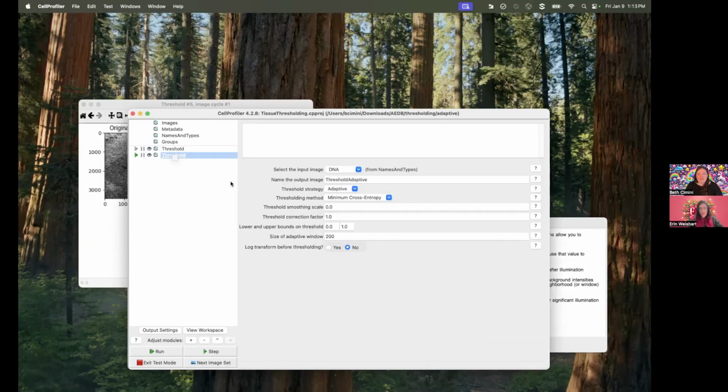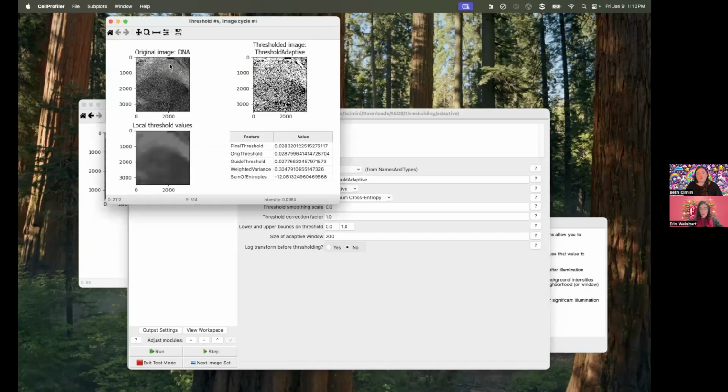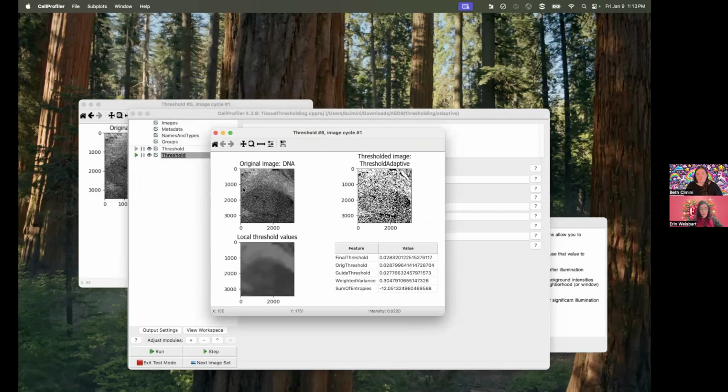So I went ahead and set up an adaptive threshold here. The major configurable thing here is the size of the window. So I picked a 200 by 200 window of the image. So in theory, each 200 by 200 block gets thresholded independently. And then CellProfiler does some magic under the hood that I won't go into, making sure that you don't have a threshold of 0.5 here and 0.001 over here. It tries to make all of the thresholds coherent, because if your window's too small, crazy things happen.